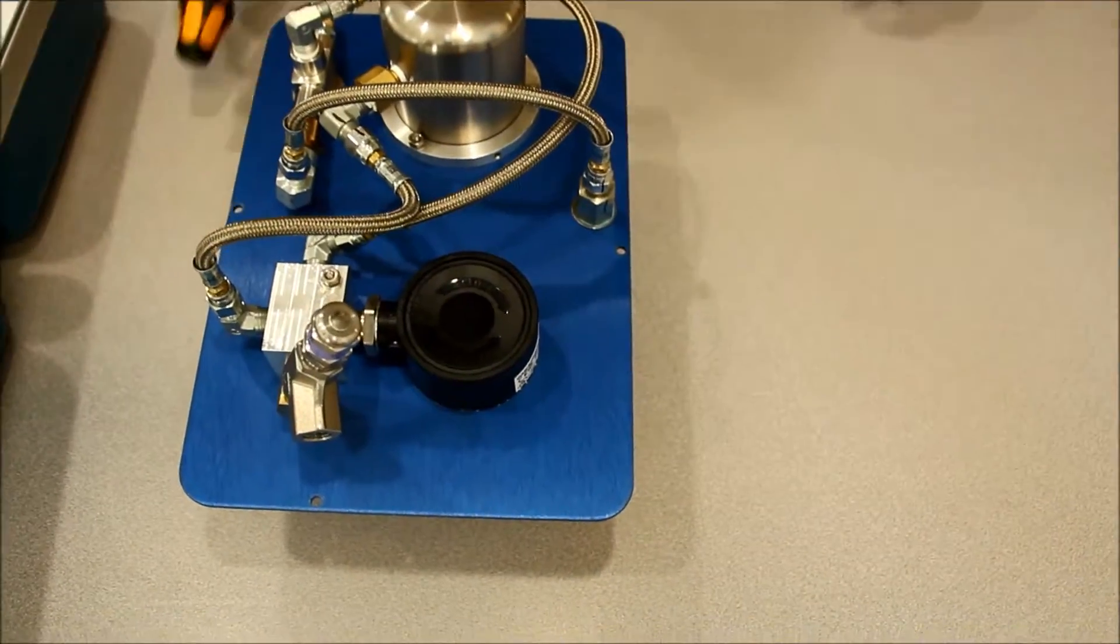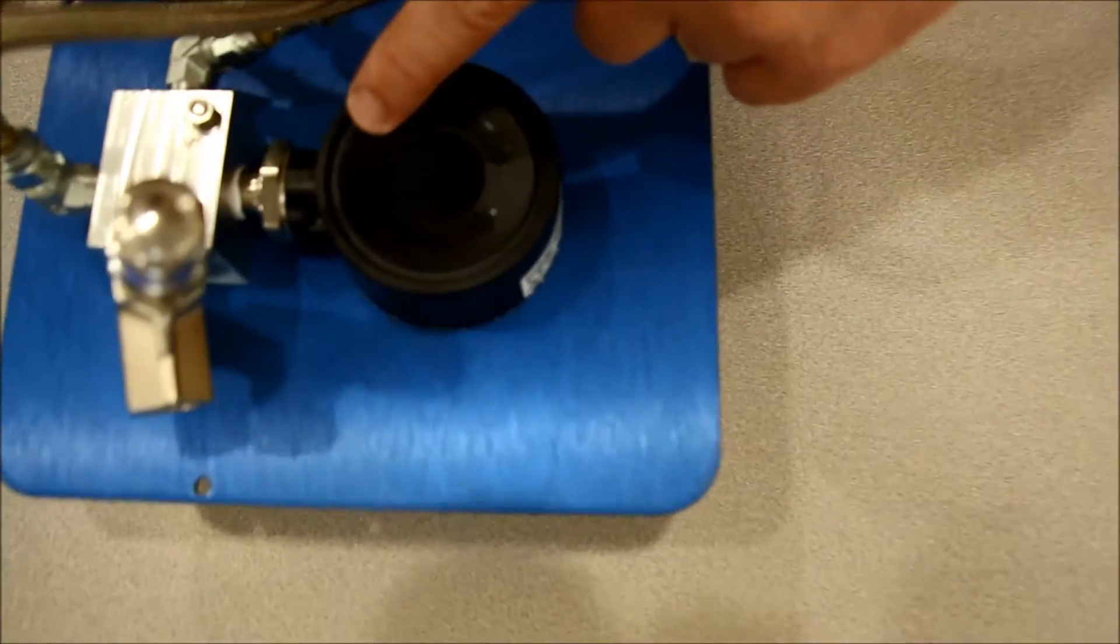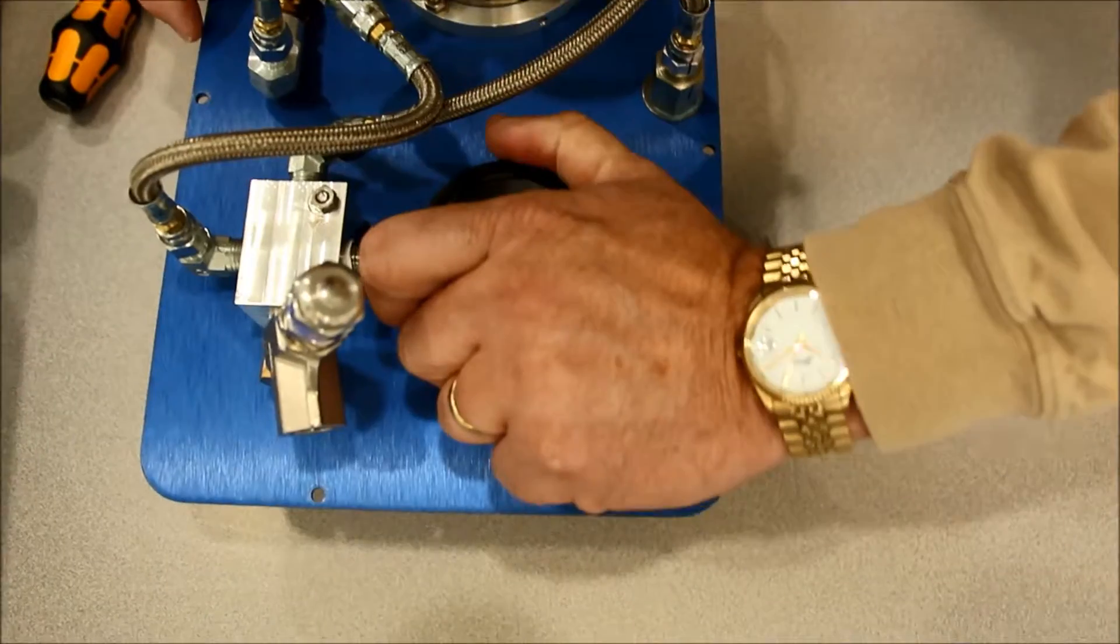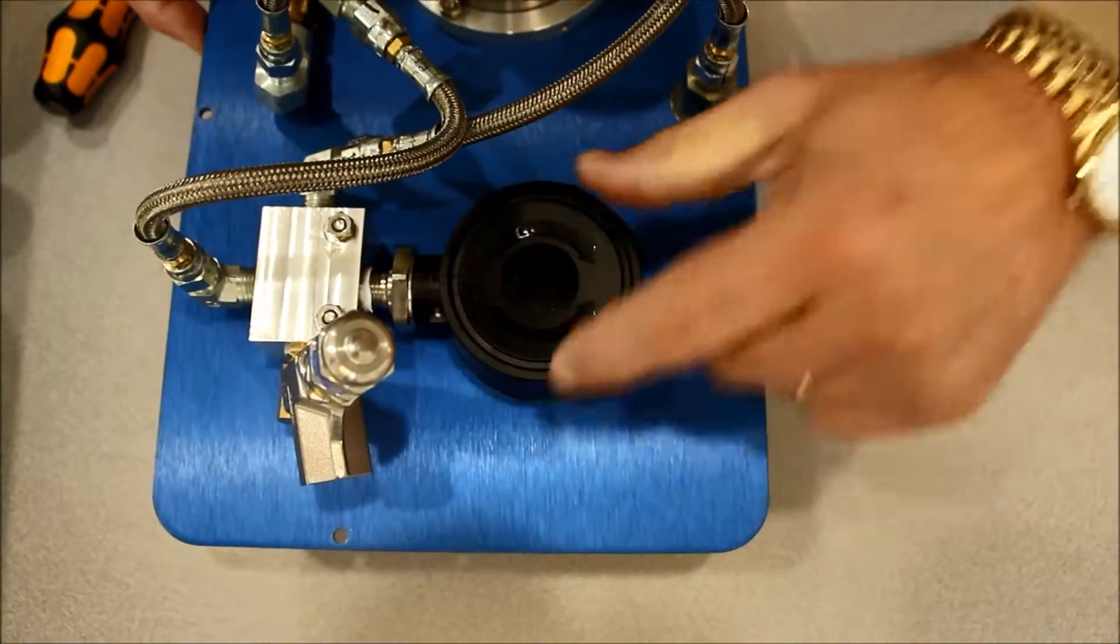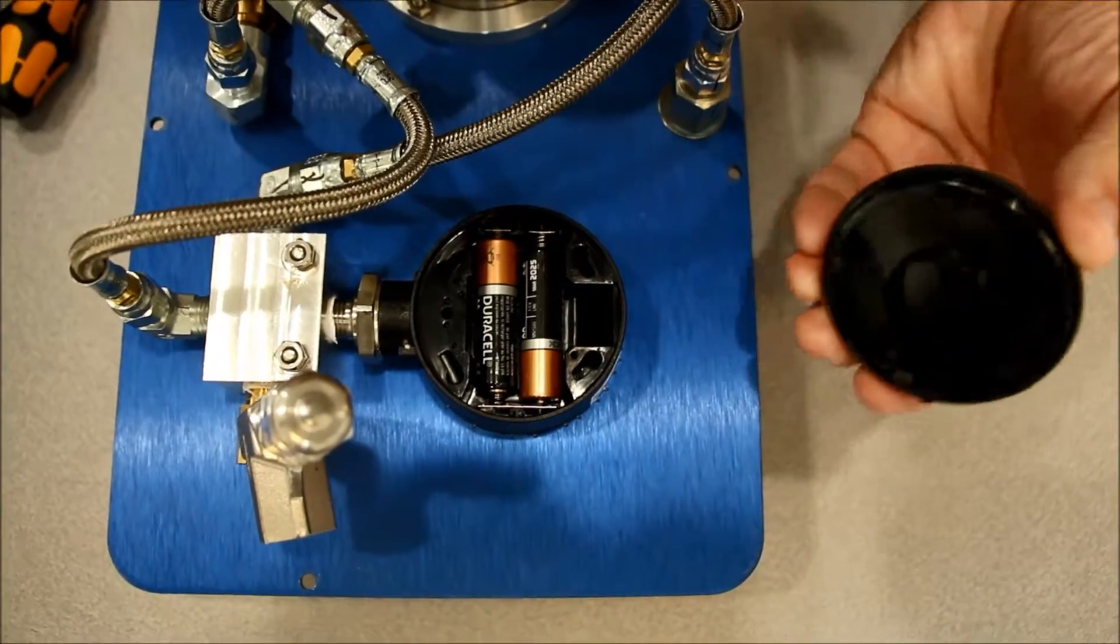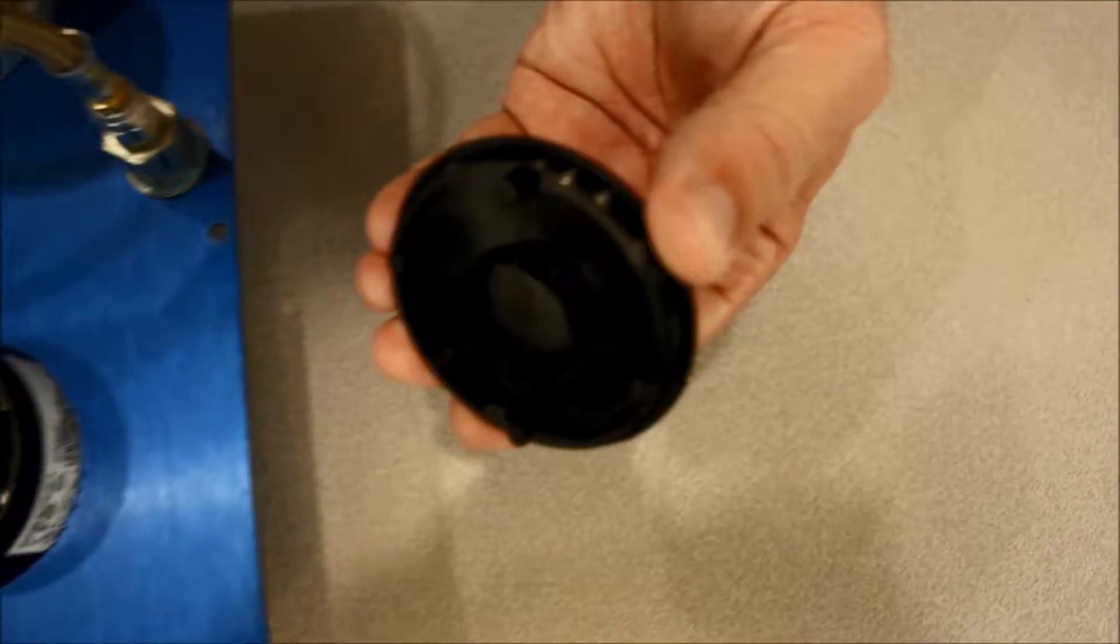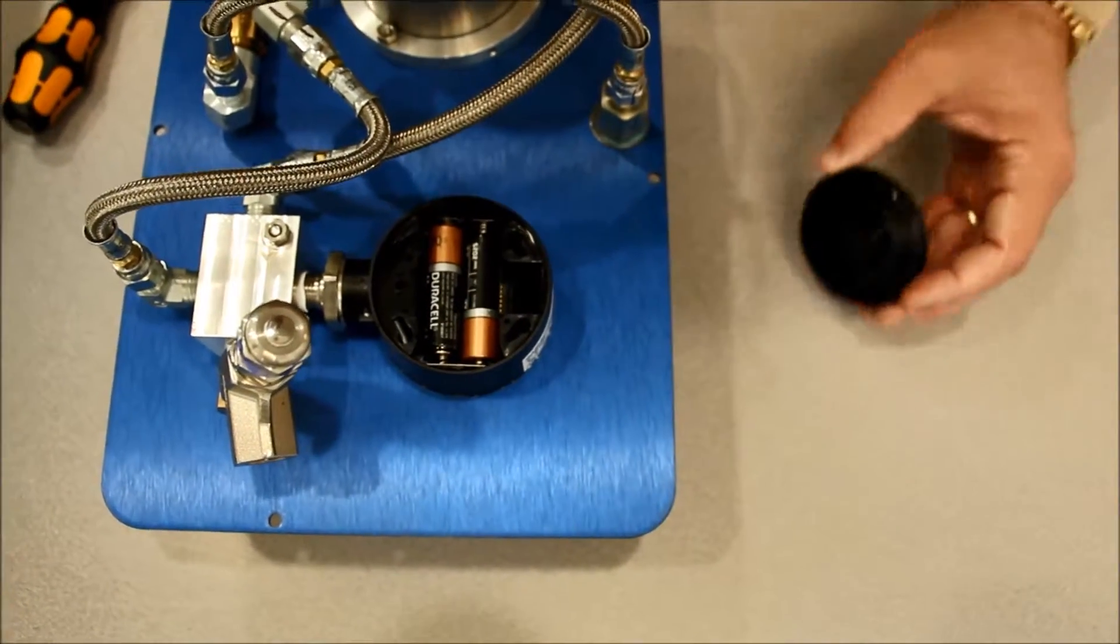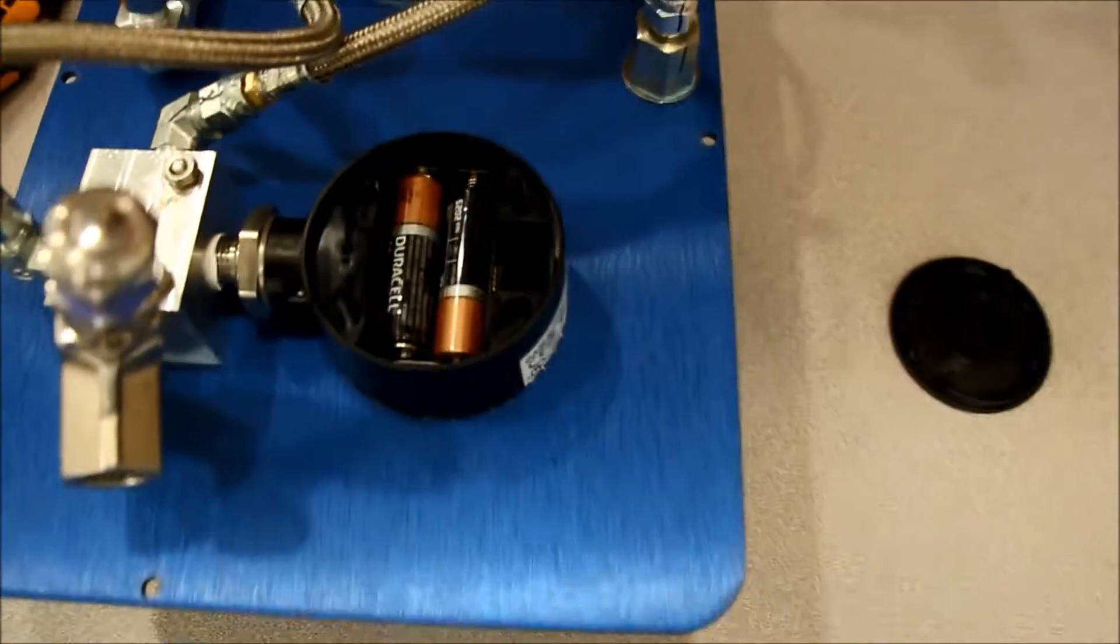The next step: if you can see, there's a locking and unlocking mechanism. We're simply going to grab it and unlock the back of the gauge, then lift it up. You can see there's an O-ring seal around there, and that O-ring seal is used to keep the inside of the gauge dry and moisture free.